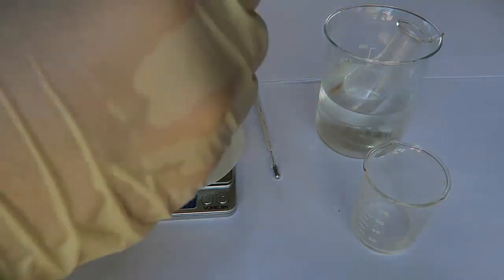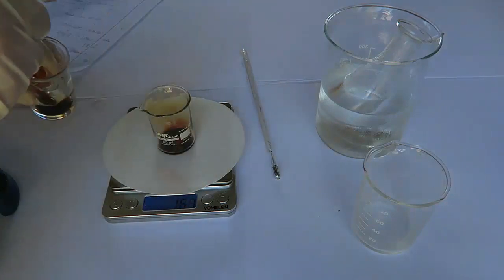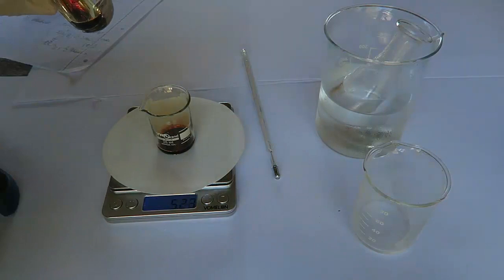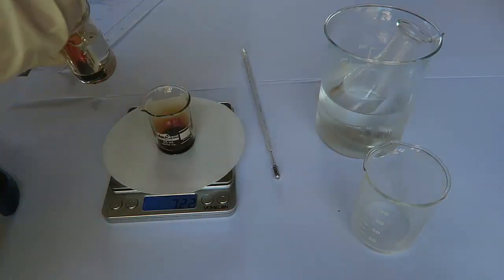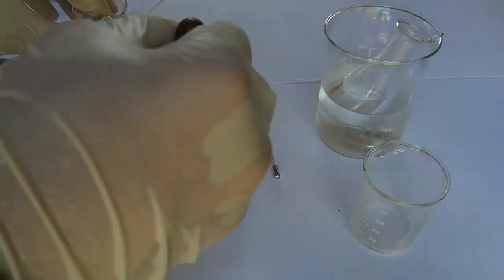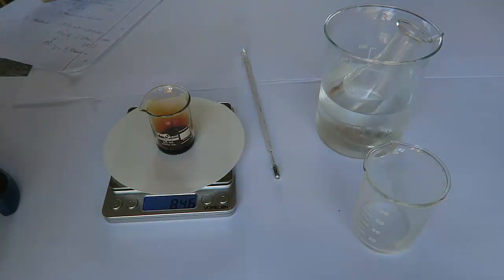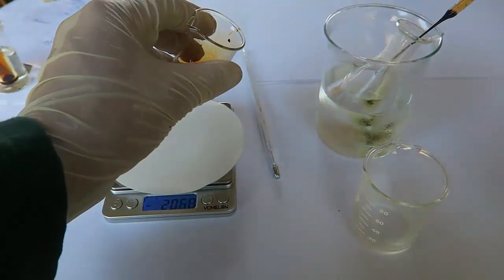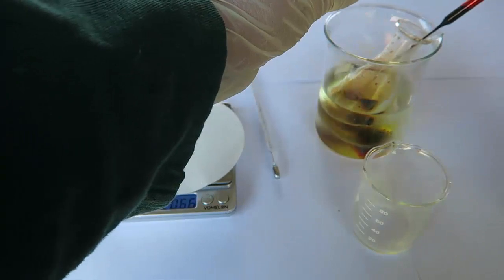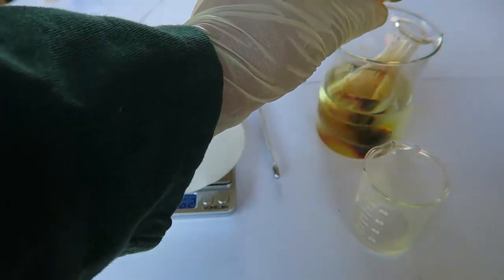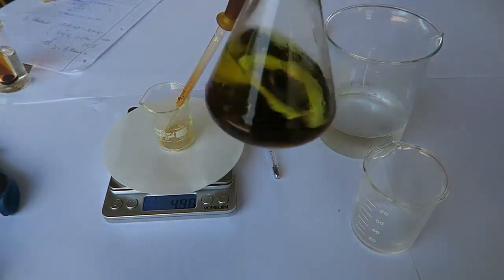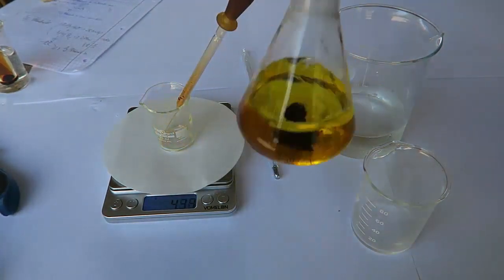For the next step, I had to crack one of my bromine ampoules. When working with bromine, everything should be cooled as much as possible to restrain evaporation. I weighed out around 8.6 grams of bromine. If you carefully observed the scale, you may notice how actually fast the bromine is vaporizing. The bromine is then added to 55 milliliters of a 20% sodium hydroxide solution. The bromine is reacting with the hydroxide ion forming hypobromite. Shaking the flask will dissolve remaining bromine.